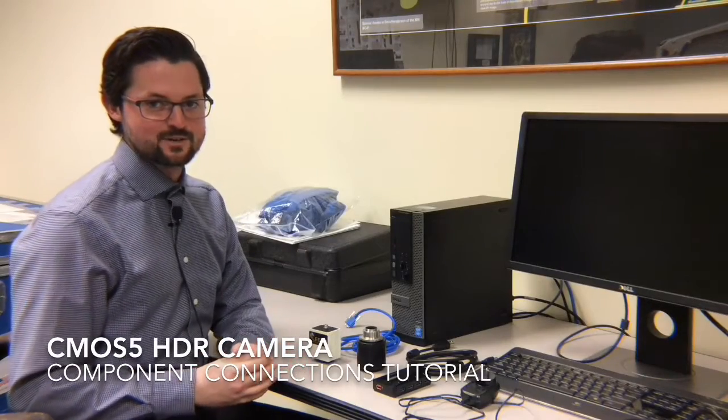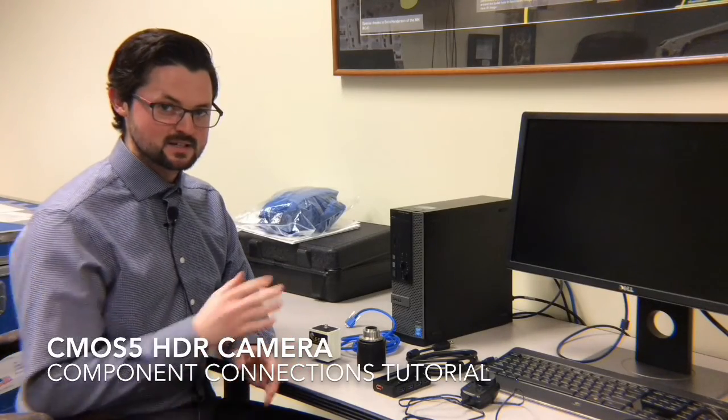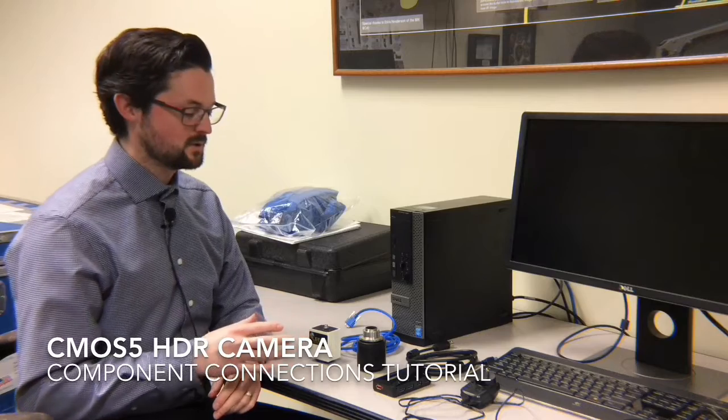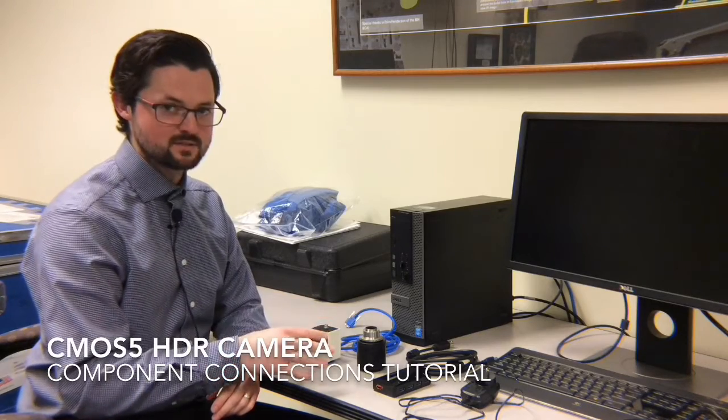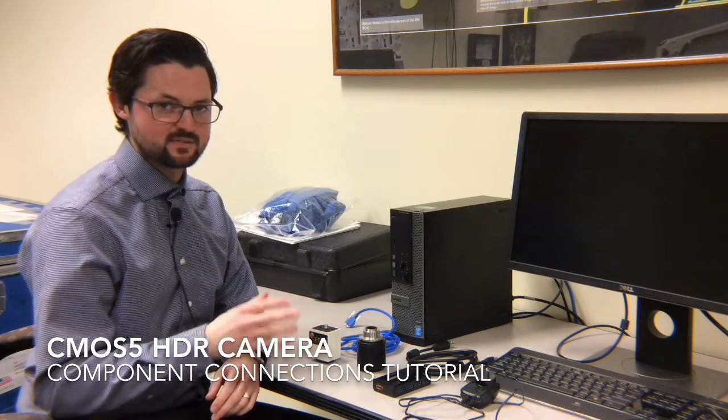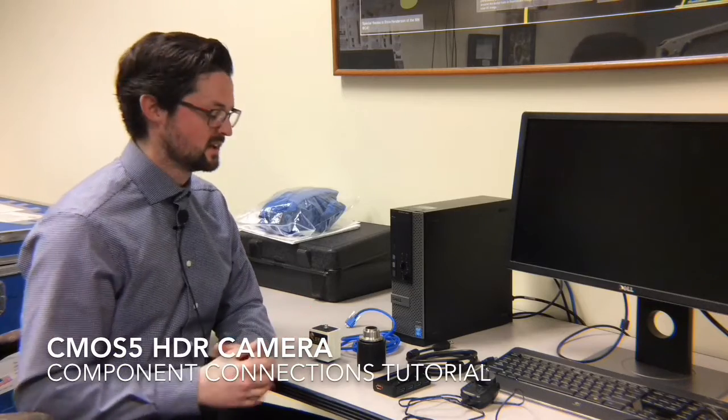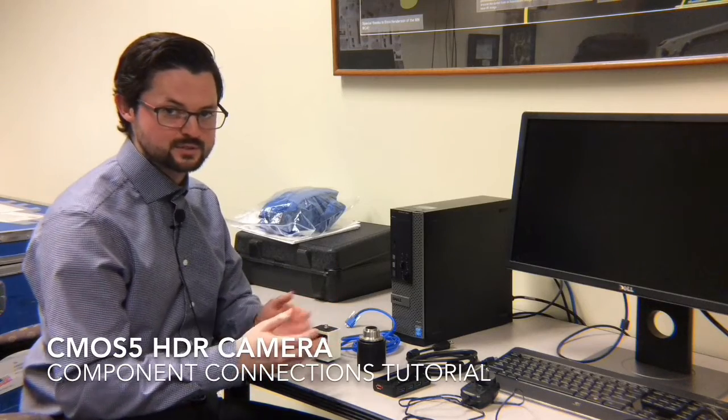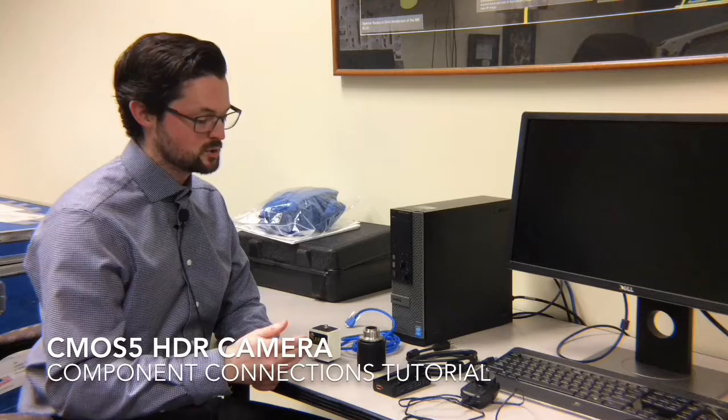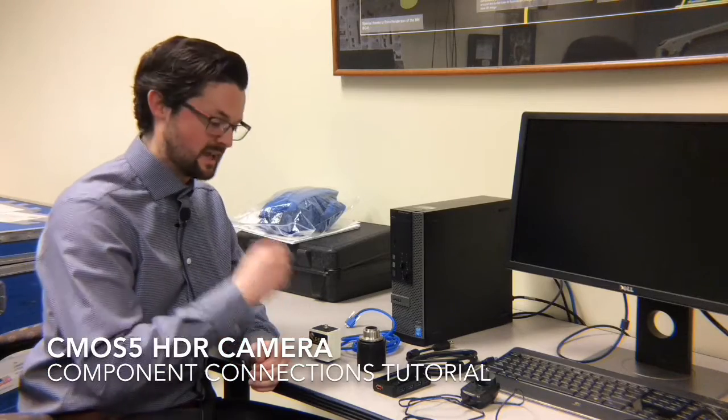Hi, my name is Jake Kurth. I'm with Leeds Forensic Systems. Today's quick video tutorial is going to be going over the components of the LCF3 CMOS 5 HDR camera kit and how to assemble all the components. Leeds has a different video which shows how to attach the camera to your comparison microscope.